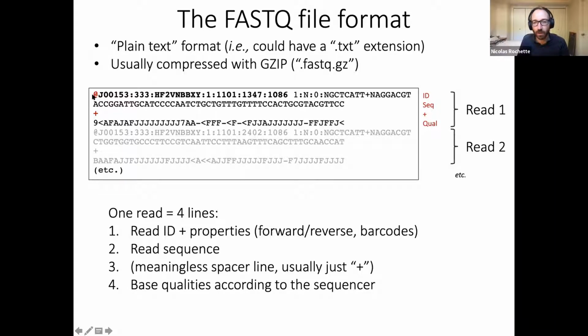And that's going to be one read. We have a read name with some extra information. This here in bold is just a read name. That corresponds to exactly where the read was. These coordinates are where the read was on the chip, on the Illumina chip. I'm not sure if you've ever looked in detail at the Illumina process, but you just get a picture and then there's a spot at some point, and these coordinates. But it's just an identifier for the read, really. It doesn't matter more than this, it's just random.